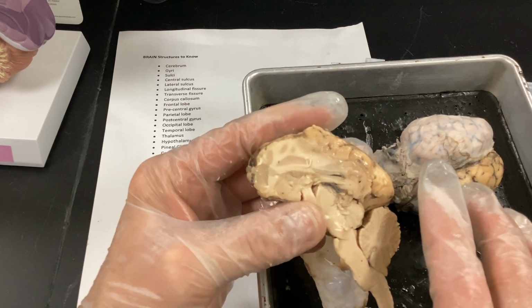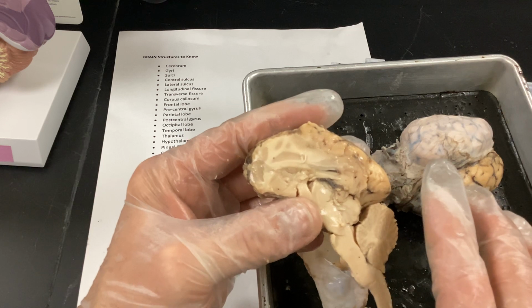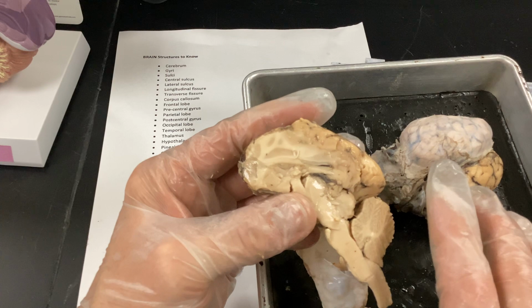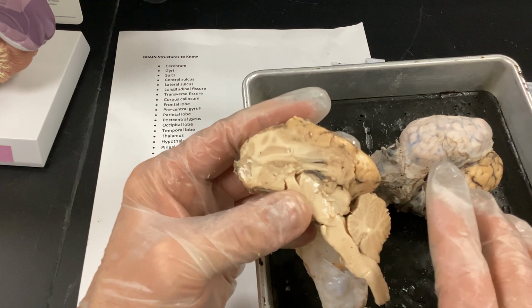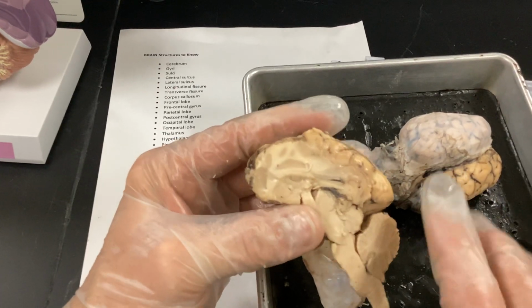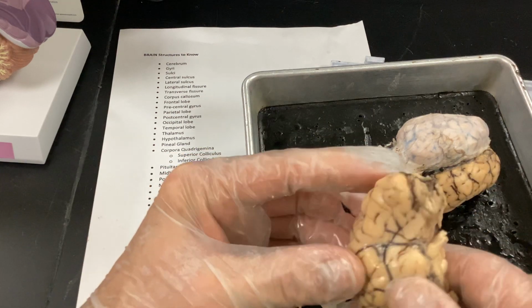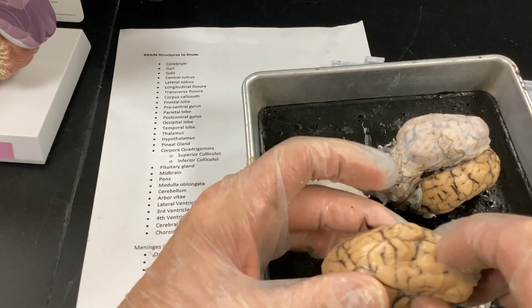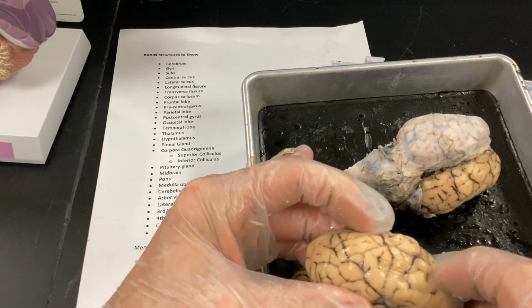Remember we talked about the phone call at 2:22 a.m. You're going to be wide awake and wondering, what happened? Why am I getting a phone call at 2:22? You're going to be going from asleep to wide awake. So cerebrum, these are gyri, these little invaginations. The deeper ones are sulci.